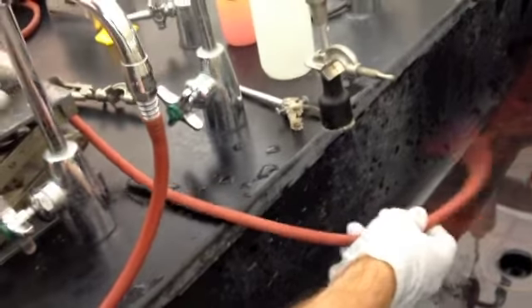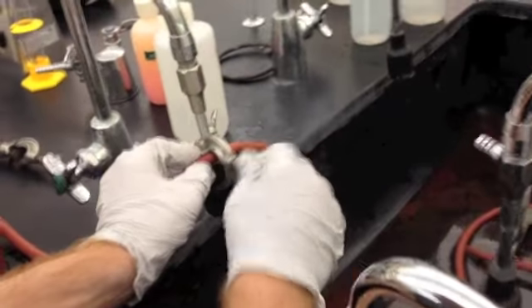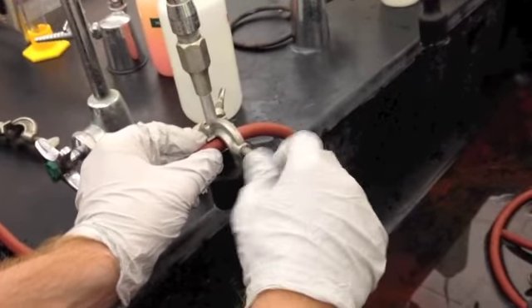Now, you also want to make sure that this outgoing tube is secured. So with some sort of clamp, just secure it in place, weigh it down, but don't restrict its motion too much.